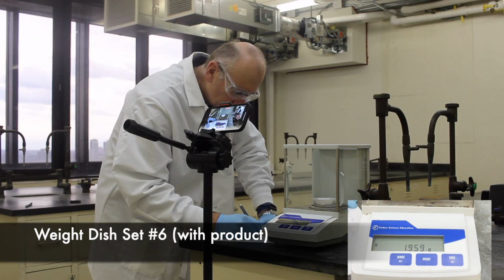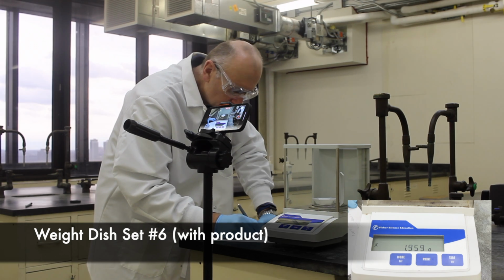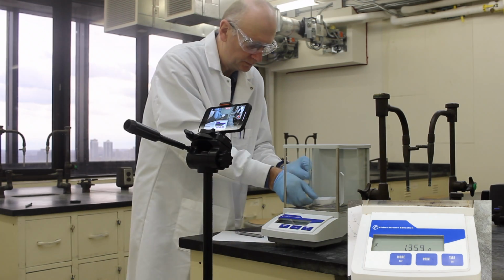By taking the difference between the set of masses and the original set, we can then determine the amount of product formed in each beaker.